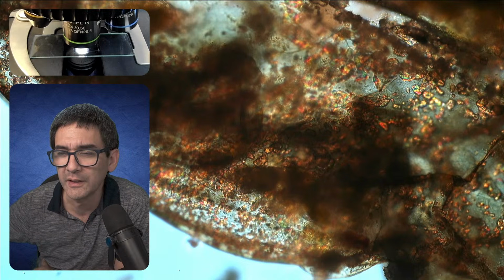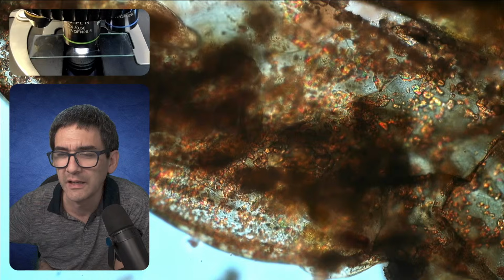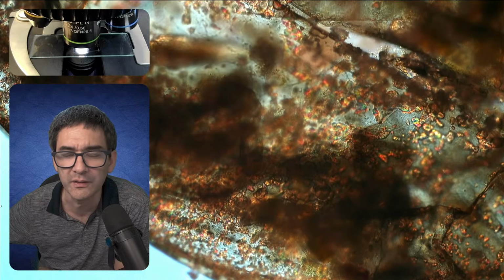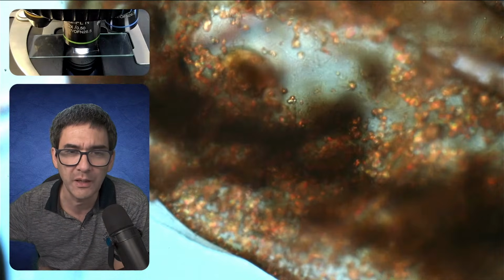So there's another comment at Microbehunter. For normal use, do you use the video display or the eyepieces more? Trying to decide if the added cost of trinoculars is worth it. That's a good one. I'll be very honest with you.